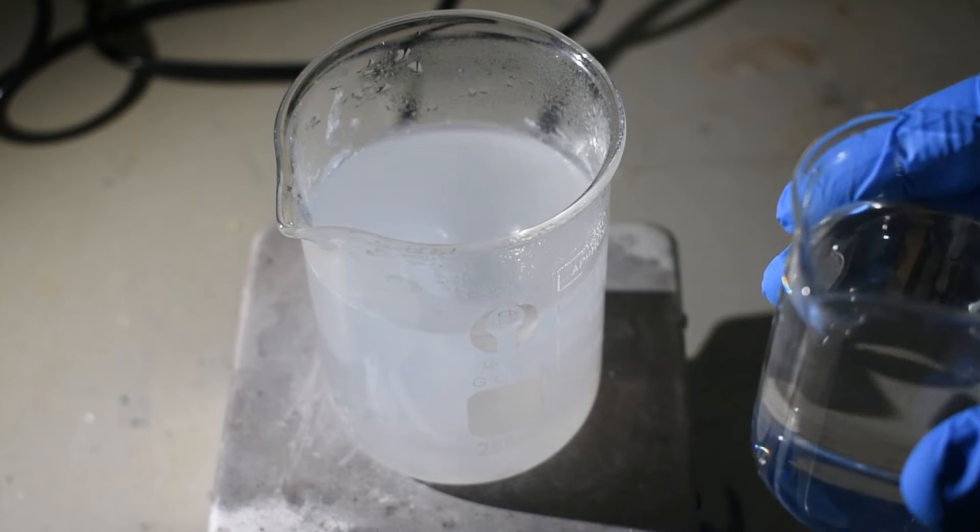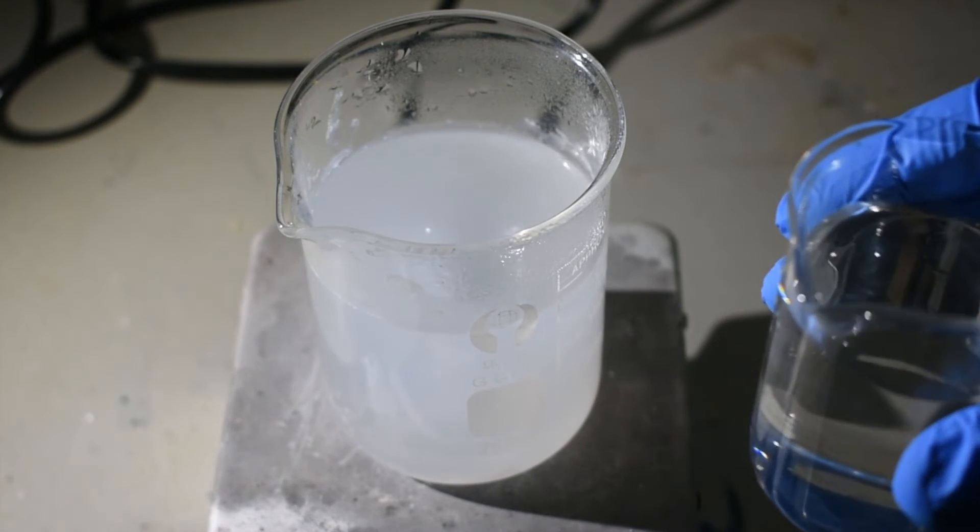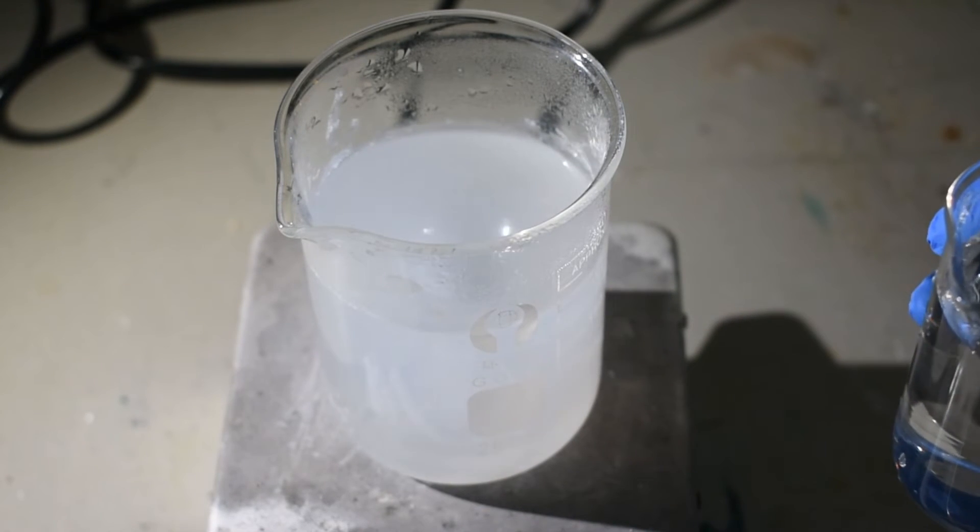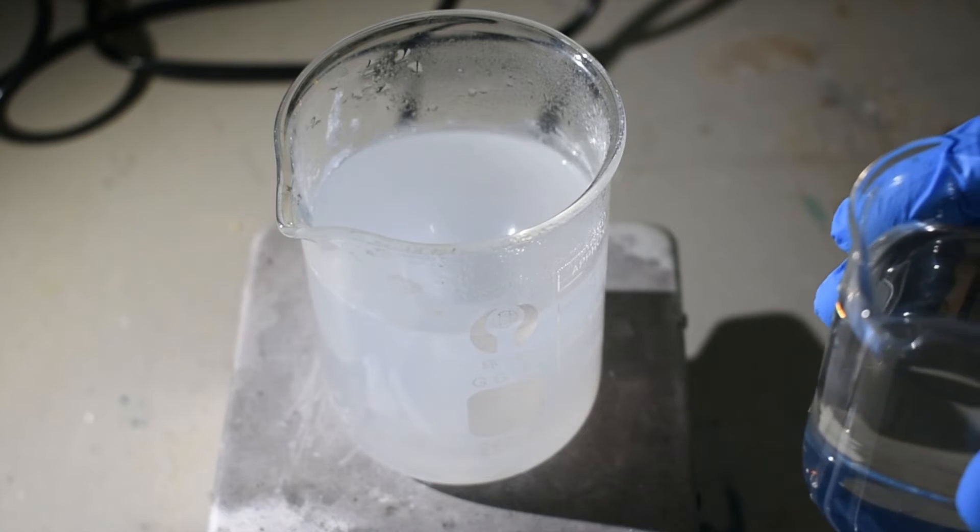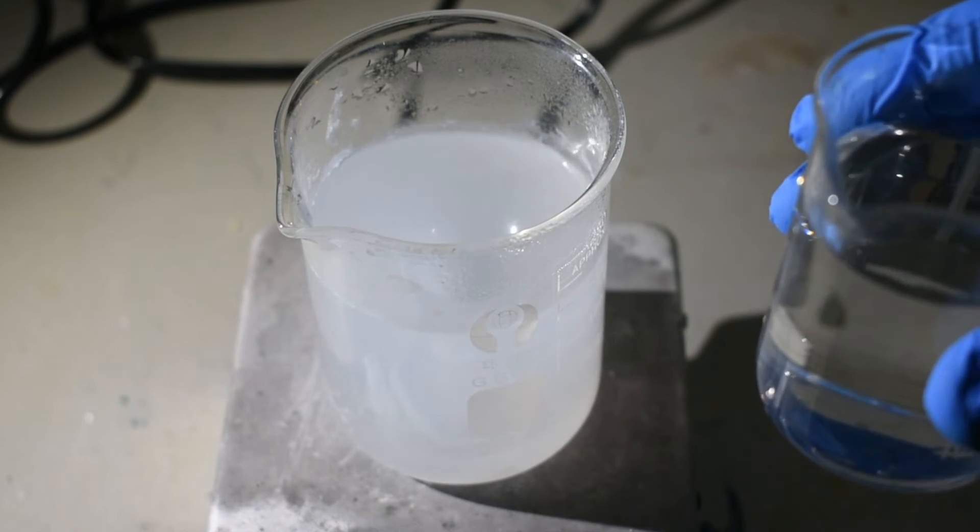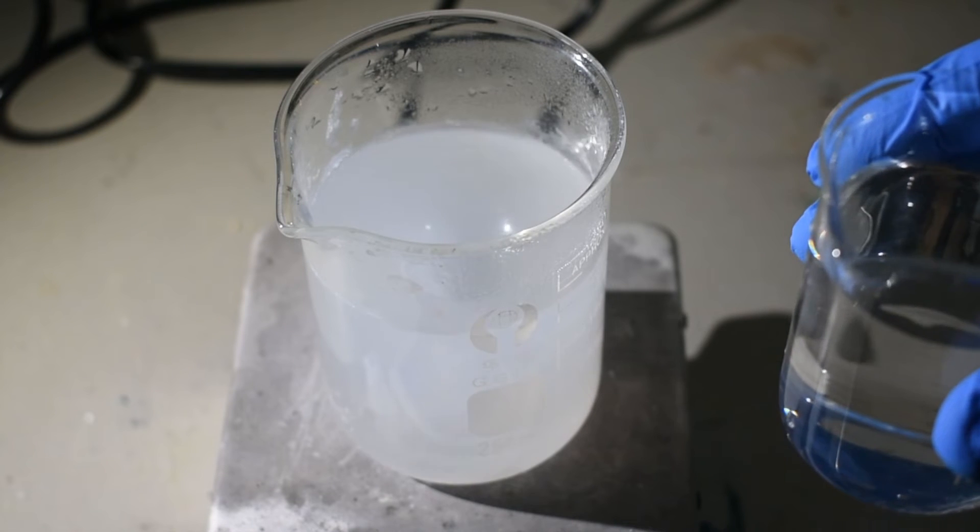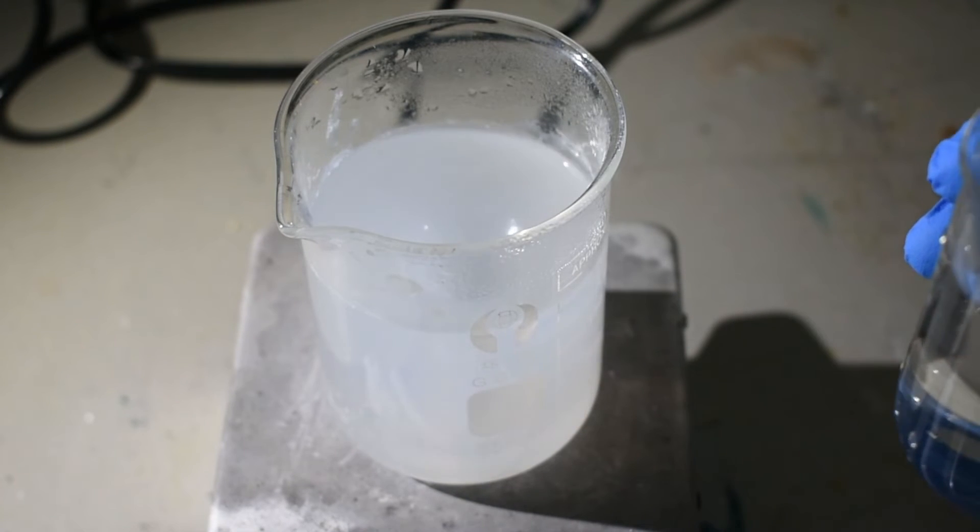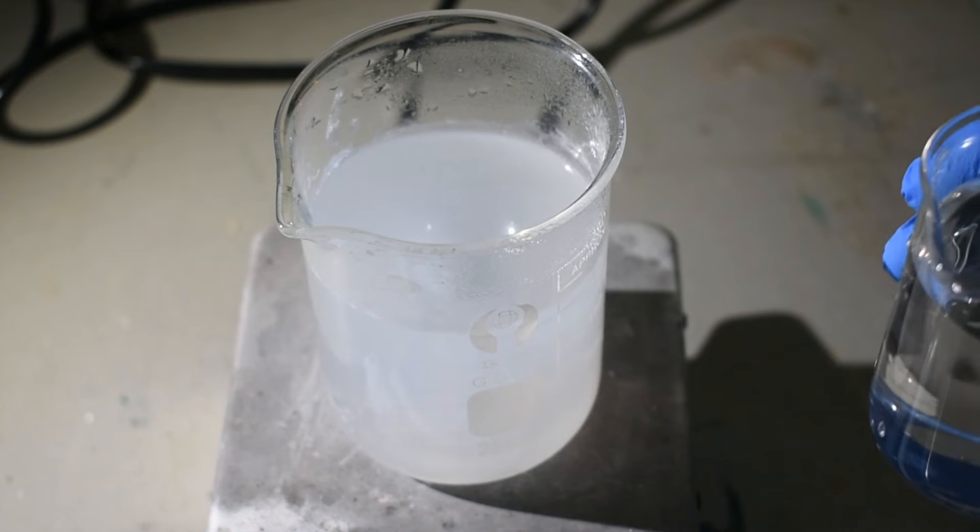So, like you probably heard me just say, upon addition of the peroxide, we're going to get a precipitate of barium peroxide as a pretty dense white slash off-white precipitate. Usually it is white, but when it dries, it tends to take on a slightly tan color. As it's formed, it should look pretty white, so let's go ahead and do that.